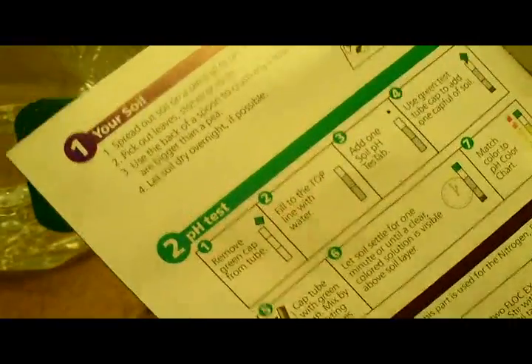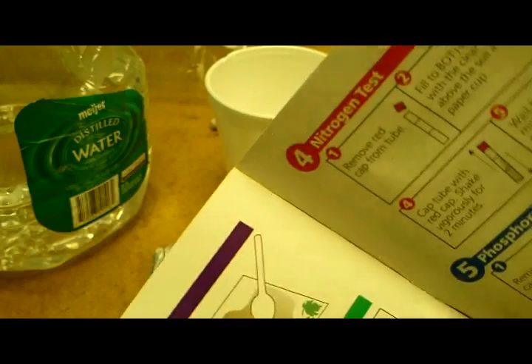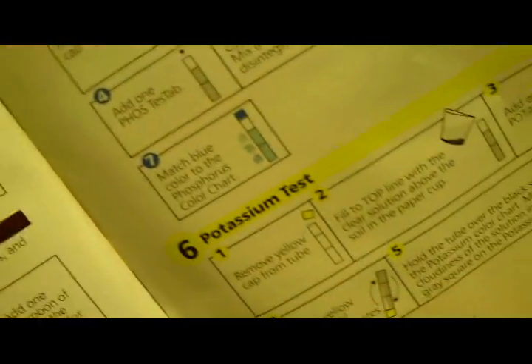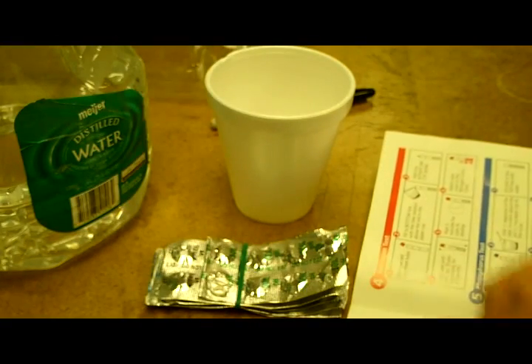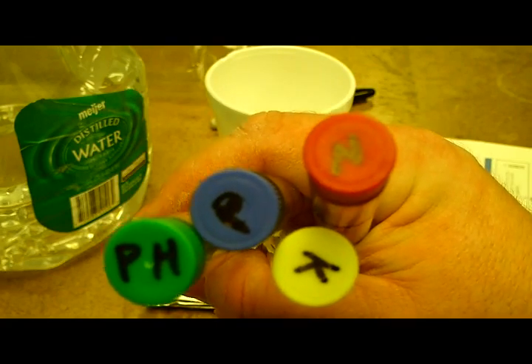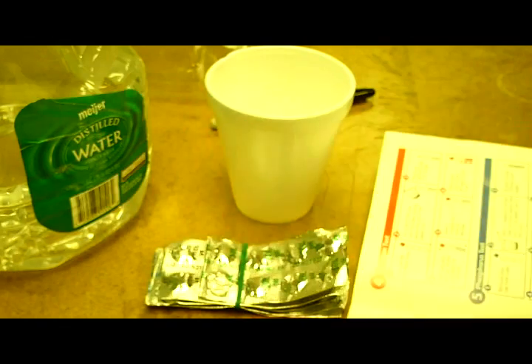The vials are color-coded: pH is green, nitrogen is red, phosphorus is blue, and potassium is yellow. I marked the caps with their periodic table element letters, and for pH I just put 'pH' on.